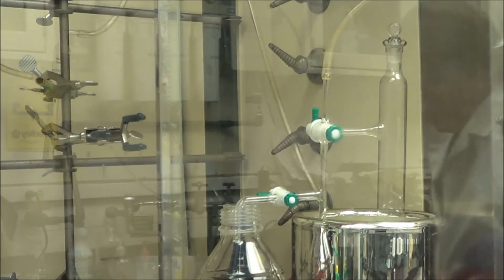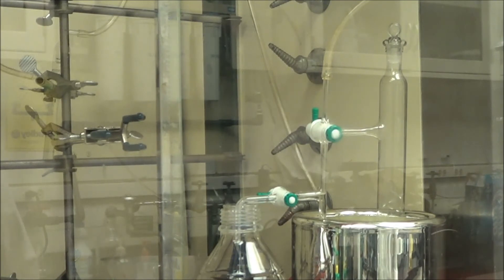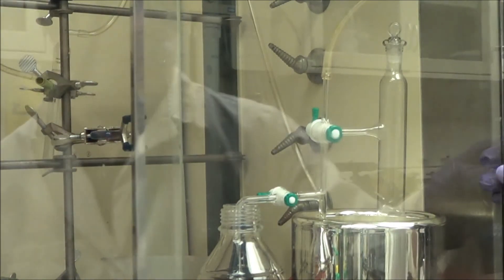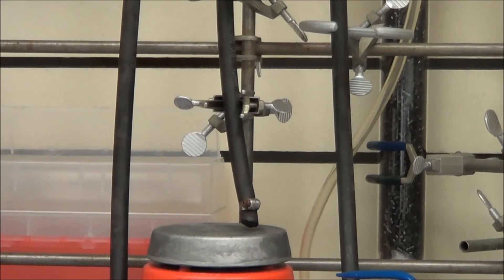I'm now pressurizing the right-hand side so that the acetonitrile comes out. And look at that flow. It's dramatically faster. And that just shows you how many impurities were removed in the first recrystallization step. And again, I usually do at least three steps.